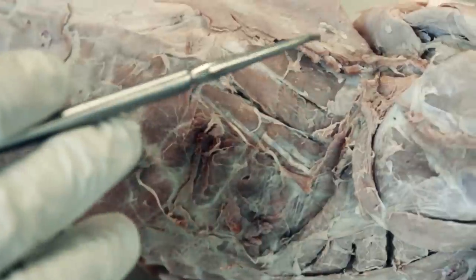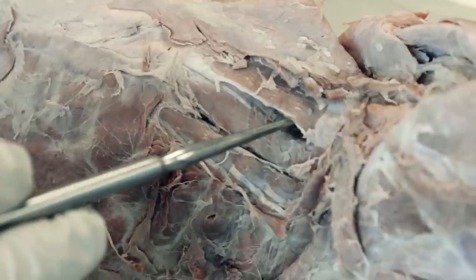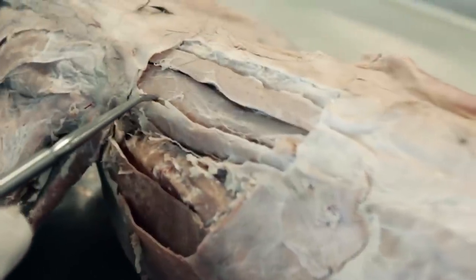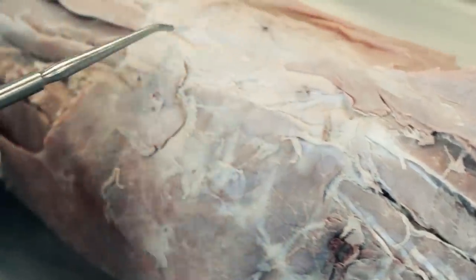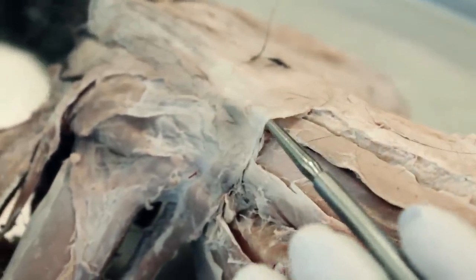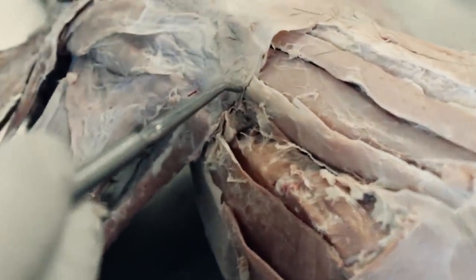Next we're going to go over some of the other deep dorsal muscles on the side of the cat. We have three muscles right here. The top muscle, the most medial, is the spinalis dorsi. This right here is part of the longissimus dorsi that extends all the way down the back of the cat — we're going to skip that one for now. This one is the iliocostalis, which sits right above the external intercostals. As we move back to the rear of the cat, we have the lumbodorsal fascia, which is an attachment point for both the latissimus dorsi, which has been removed on this side, and the external oblique.